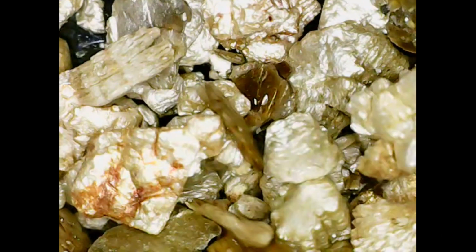You can see here, I think if I'm not mistaken, in this section, I have added in some water, or some water is just about to come in, and you might be able to see some of it that's moving around and floating around. It's within that water, and you can see those slightly more jagged edges have started to soften up because, again, that water is adhering to it.